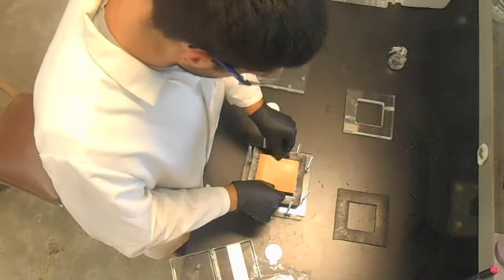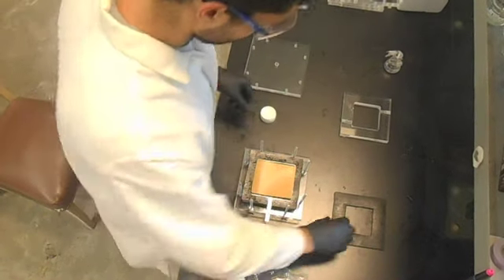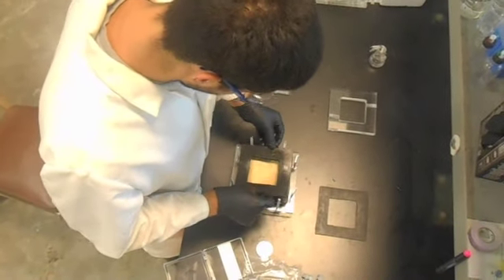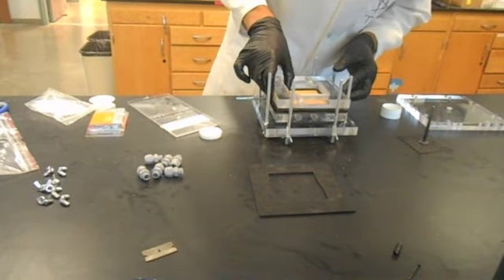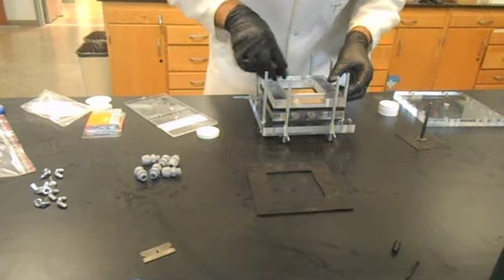As you can see, the tab that extends from the current collector is not in the same direction as the holes of the interior frame, thus minimizing clutter. Place the cation exchange membrane on top of the cathode and then coat and place a rubber on top of it. Place the anodic half cell over the rubber and make sure that it lines up with the cathode half cell as best as possible.